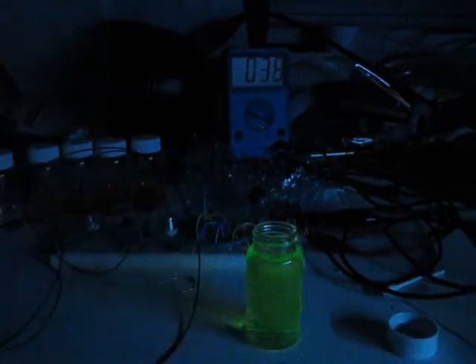It's purple slash low UV. The camera probably won't pick it up very well, it'll just look like a very overexposed white dot. It doesn't act very well on this highlighter dye, which I believe is fluorescein, compared to these deeper UV wavelengths, which I can't seem to get my handheld UV light source to work, so we'll forget about that for now.